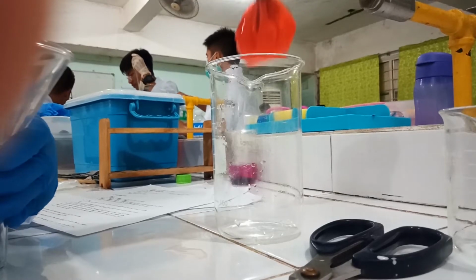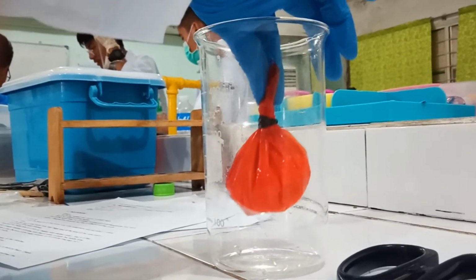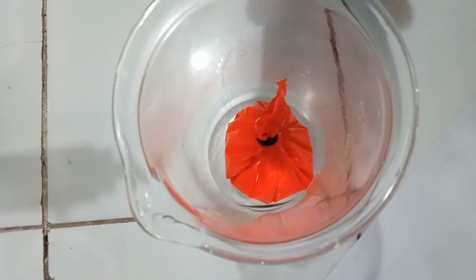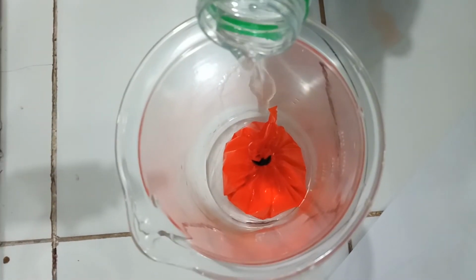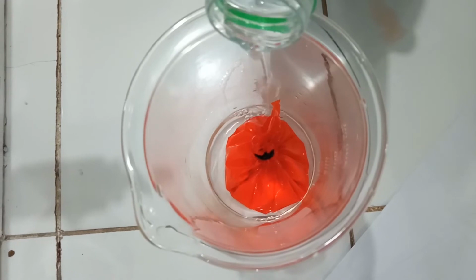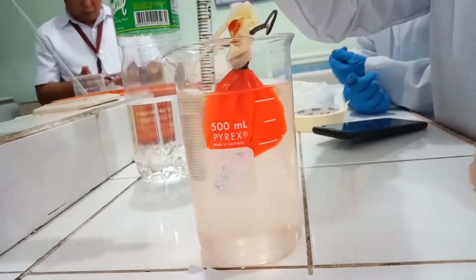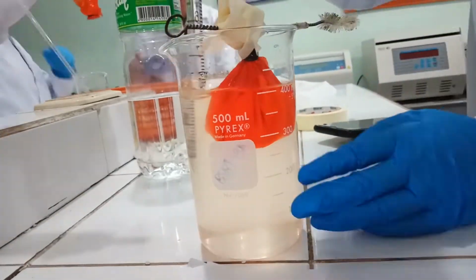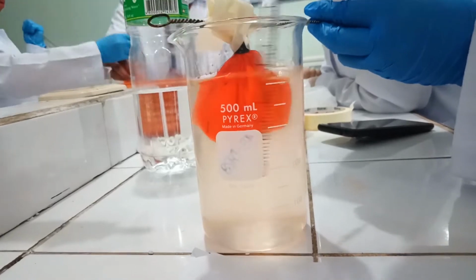Fifth, place the bag into a 500 ml beaker and suspend it so it almost touches the bottom. Then, add distilled water to the beaker until it is at the equal level with the surface of the milk. Last, stir the water outside for 1 hour to let the milk dialyze. Test the recovered dialysate for the presence of protein and sugar.